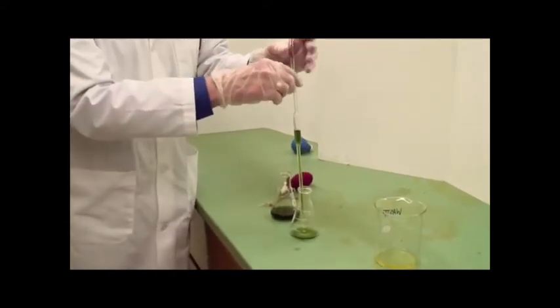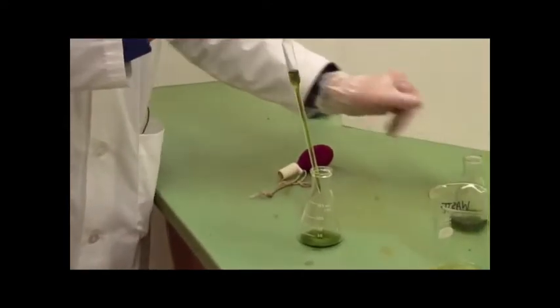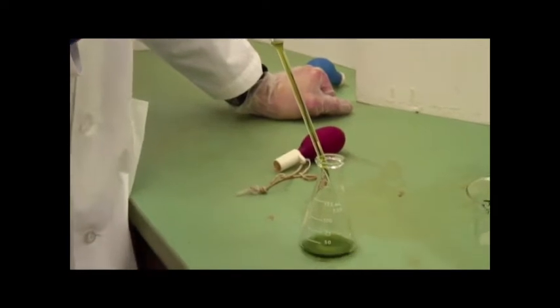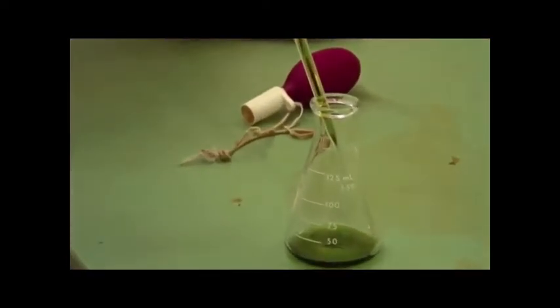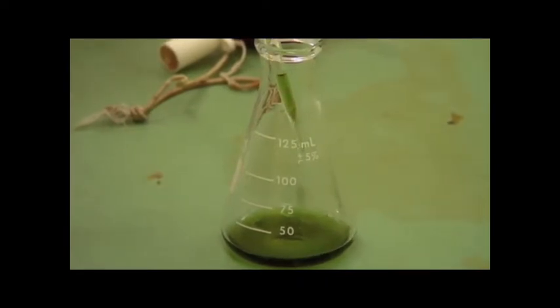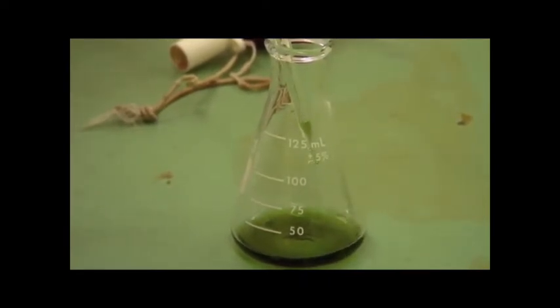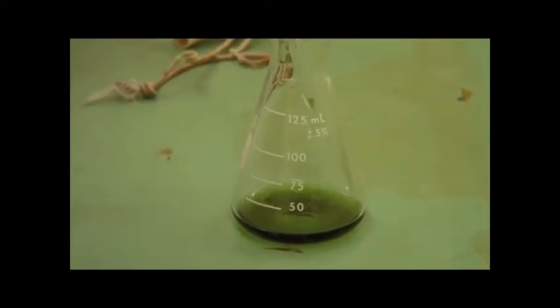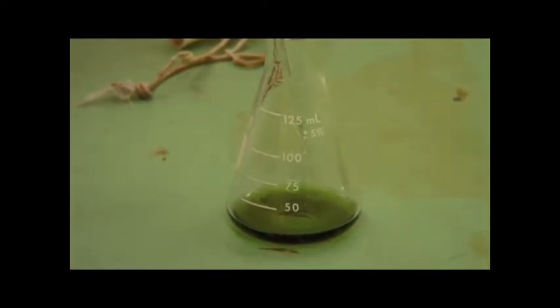You need to be patient and let gravity do its thing. This is now dispensing 10.00 mils, or an aliquot of 10 mils. And once the flow has stopped, you count 10. 1 hippopotamus, 2 hippopotamus, 3 steamboat, 4 steamboat, 5 Mississauga, 6 Mississauga, however you wish to do it.